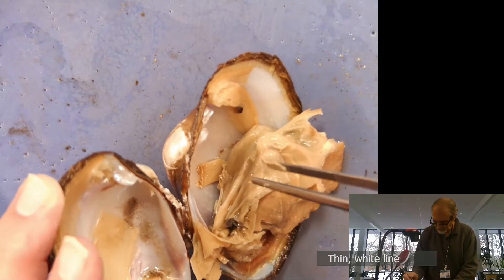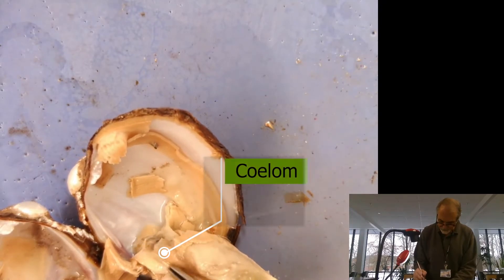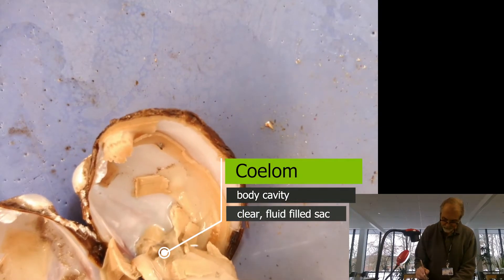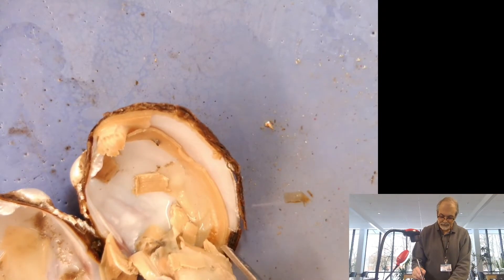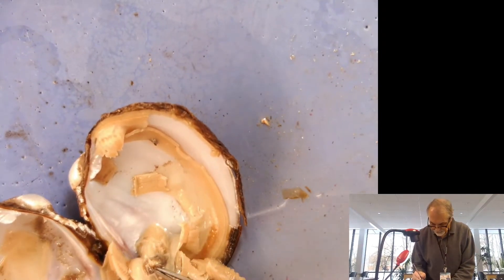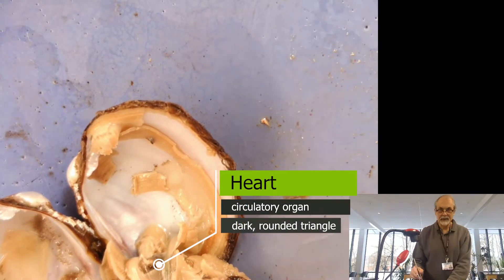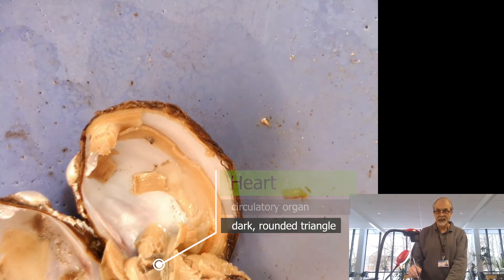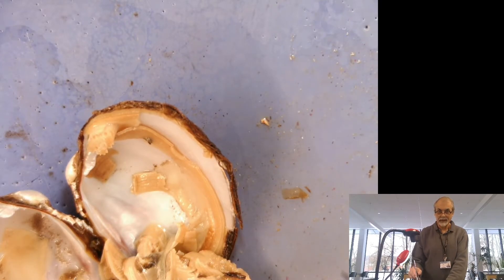That's part of the intestine. And then up above it there's a clear, fluid-filled space — that's actually what's called the coelom. The coelom has fluids and it's usually under pressure. This dark area just above where the coelom is — that's the heart. What the heart does is pumps blood, or pumps fluids, into the coelom, which is fairly small and just surrounds the heart, and you don't typically see that blood moving through the whole body.